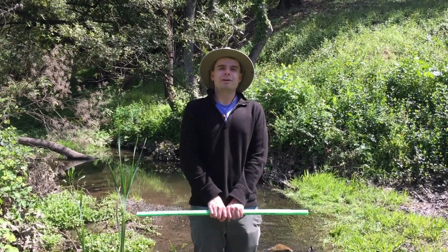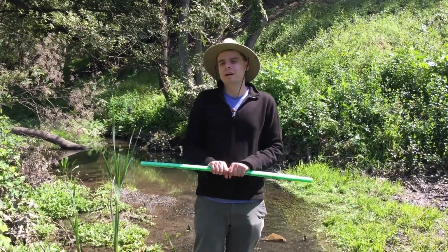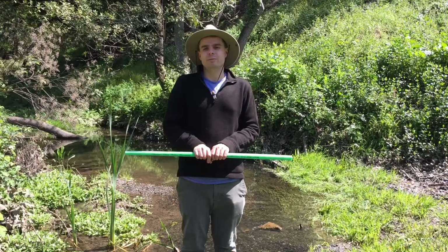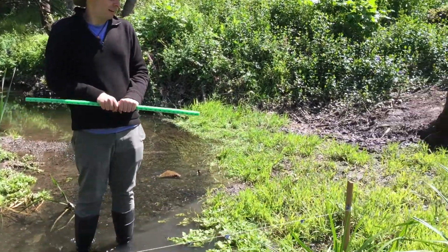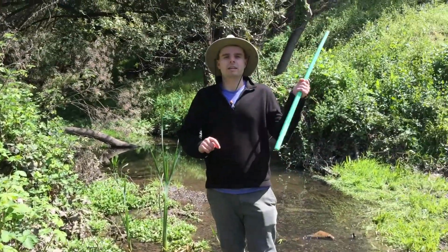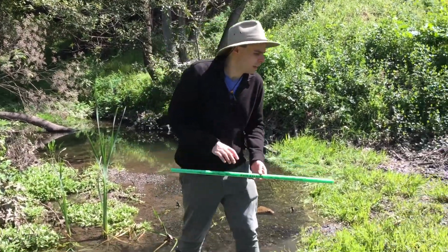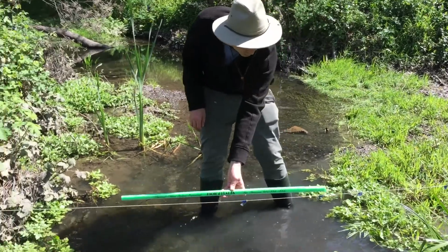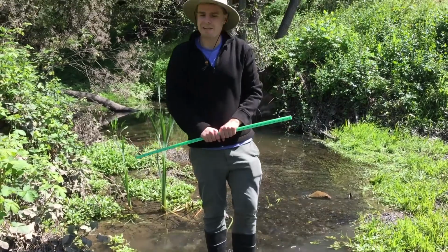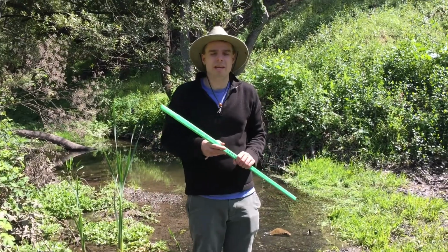Now we get to the part I find is the longest but also the most interesting part of taking water samples from a creek: measuring the discharge of the creek. What I do is I take two stakes and place them at either end of the banks of the creek, and attach a rope between them. Then I take a measuring stake, or in some cases a measuring tape, and I measure the width of the stream. This one would be roughly, say, about 10 feet. And then I go and measure the depth of the creek at different intervals.